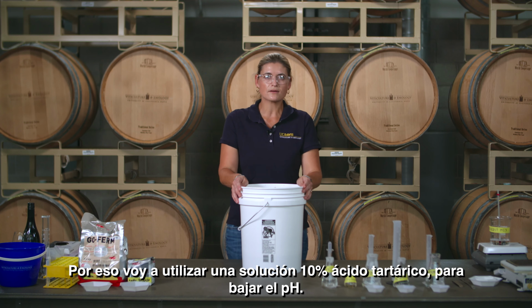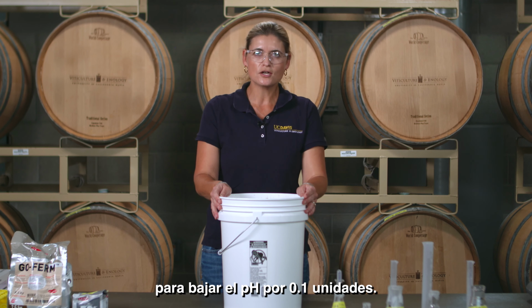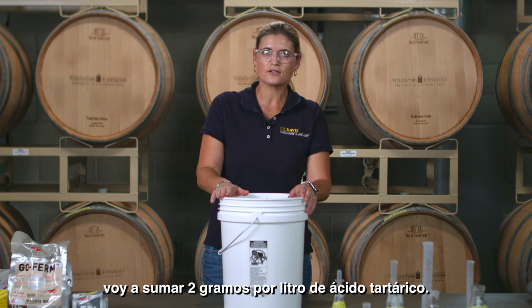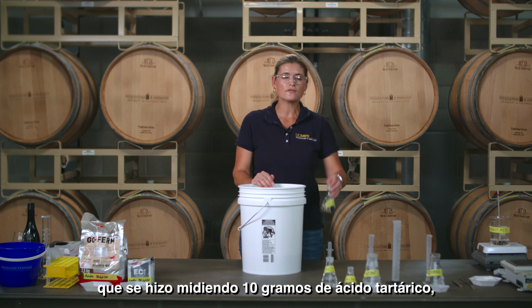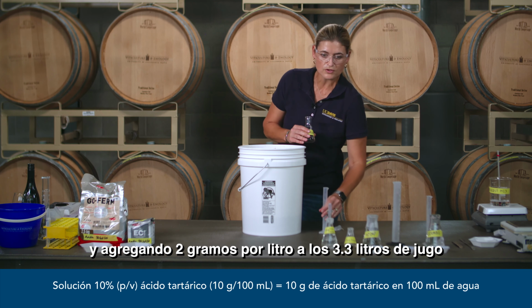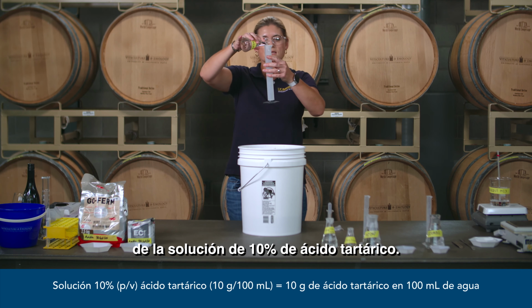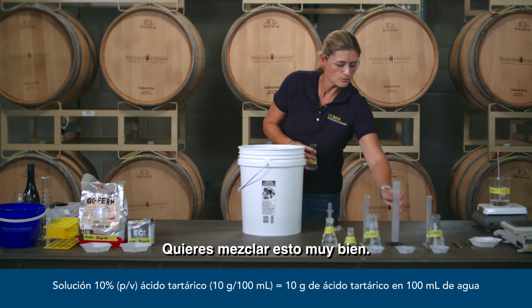So I'm going to use a 10% tartaric acid solution to bring the pH down. The general rule of thumb is that you add 1 gram per liter of tartaric acid to lower your pH by 0.1 units. So if I want to lower my pH by 0.2, I'm going to add 2 grams per liter of tartaric acid. I have here a 10% tartaric acid solution. This was made by weighing off 10 grams of tartaric acid and dissolving that in 100 milliliters of water. With my calculation and adding 2 grams per liter to 3.3 liters of juice, I'm going to need 66 milliliters of 10% tartaric acid solution. You want to mix that in really well.